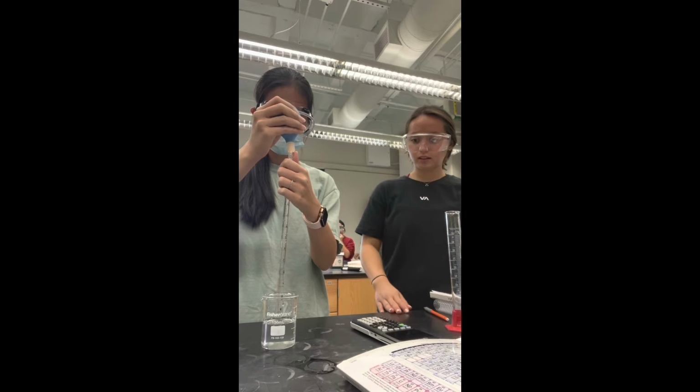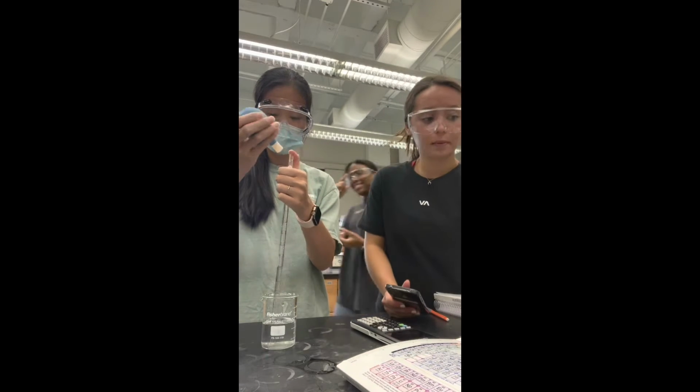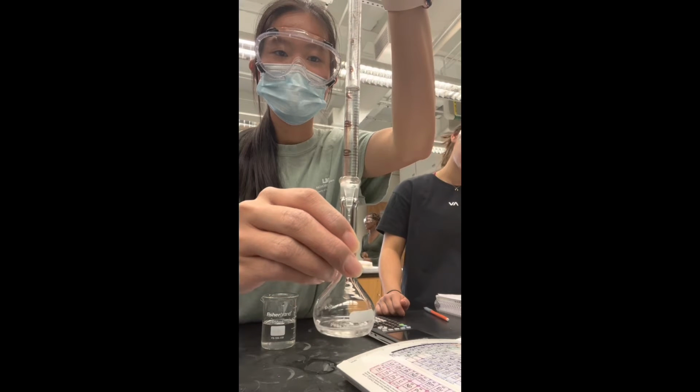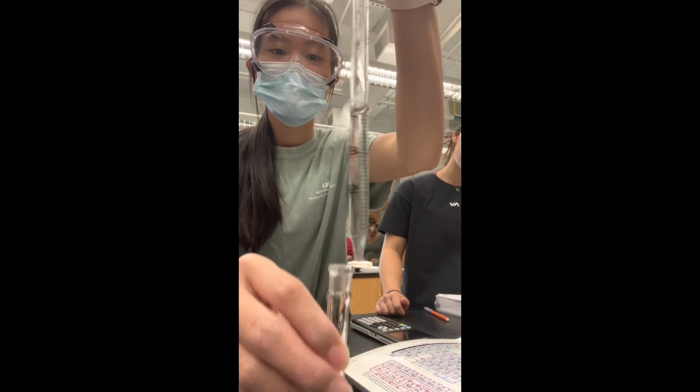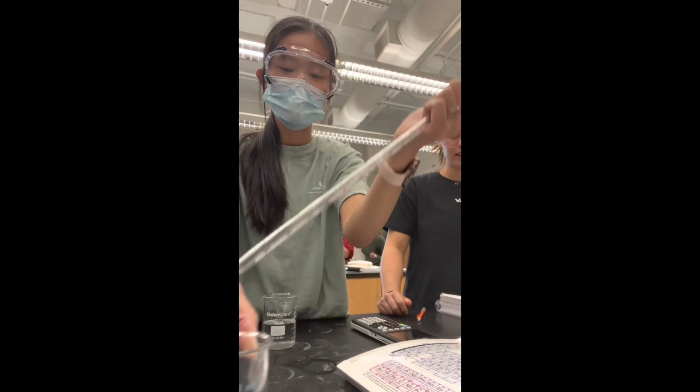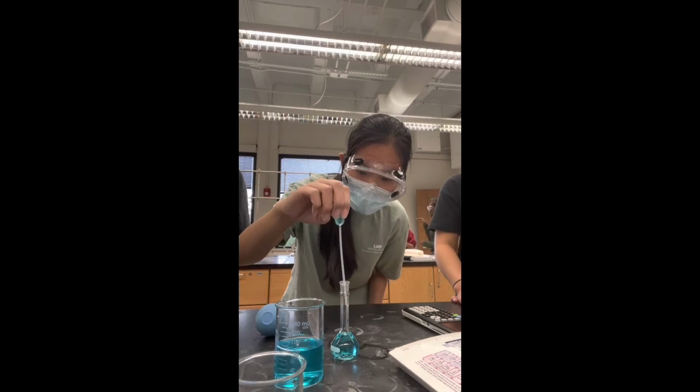Up next was Michelle. Her initial volume was 7.12 milliliters. Her final volume was 6.91 milliliters. Her volume was 0.21 milliliters, and you multiply that by the 20% concentration, and the overall concentration was 0.17%.